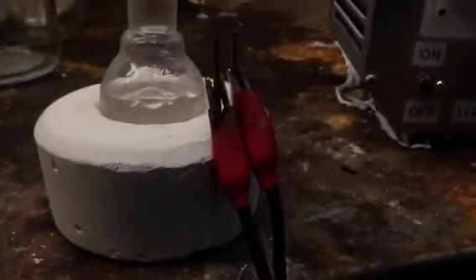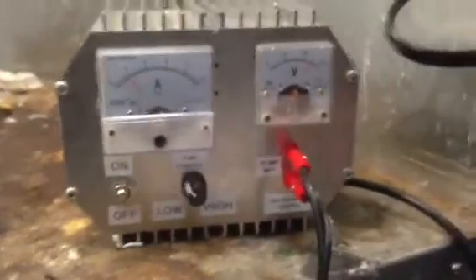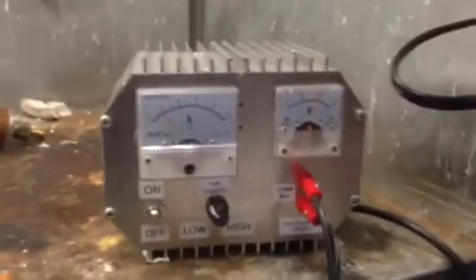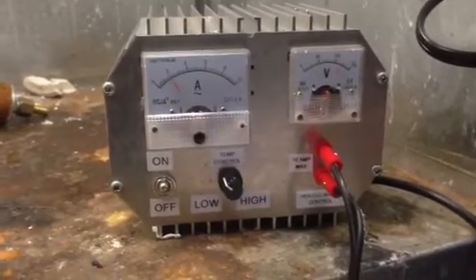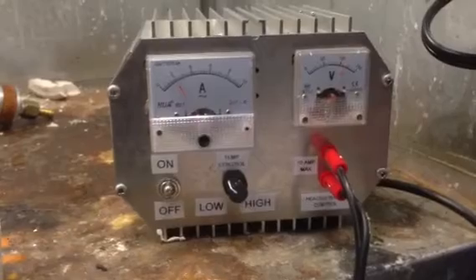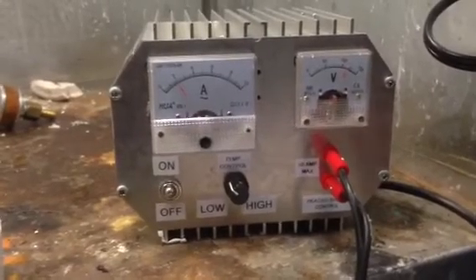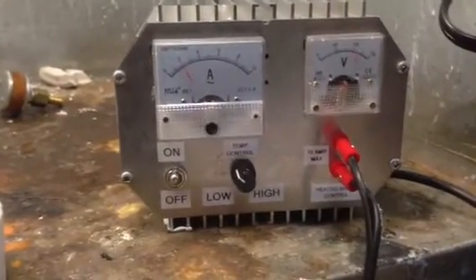So basically if you've seen my other videos you know how to make these heating mantles. So you build yourself a heating mantle, find yourself a box. Now I know some of you don't have a lot of electrical experience but I can tell you right now this is one of the easiest electrical projects that you could do yourself.